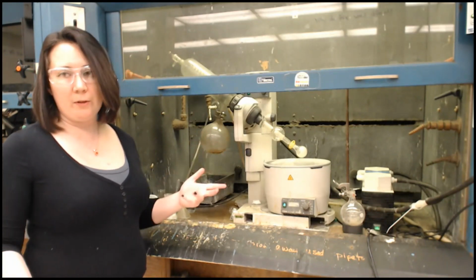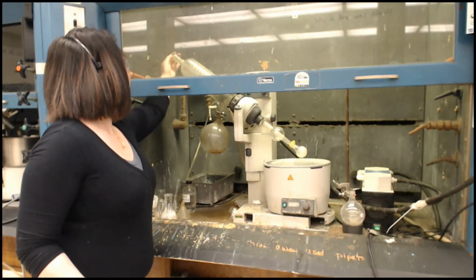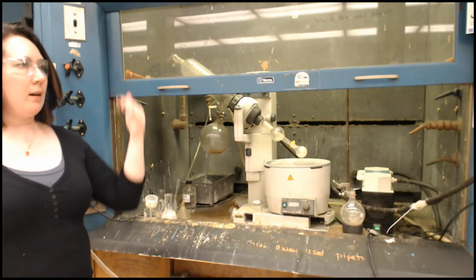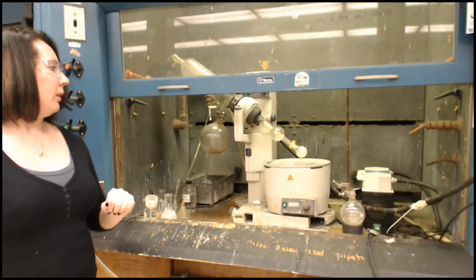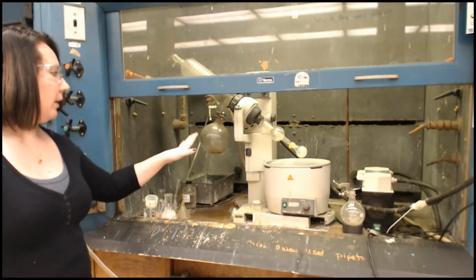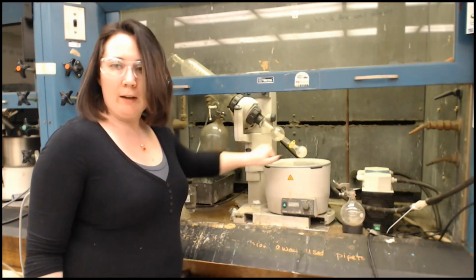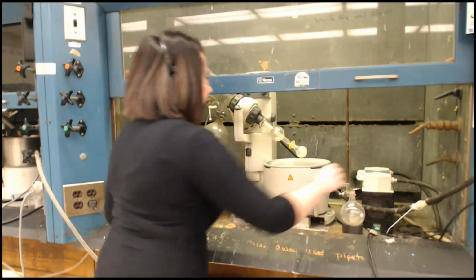Disconnect the vacuum before you turn anything off. So the vacuum's still there, so I'm just going to open the valve here. If you were here, you would hear it hissing. It'll kind of peter out a little bit. It'll hit a constant tone, or you could just feel for it as well. And then if it's done, you go ahead and stop. So you can see we have solid now. I've opened this, so I'm going to turn the pump off first.